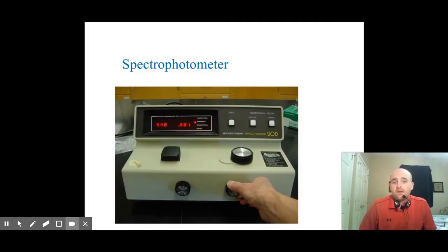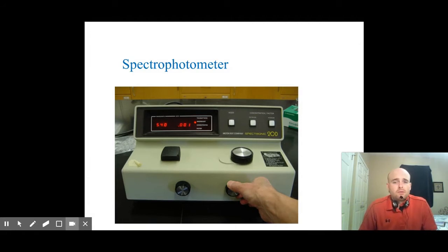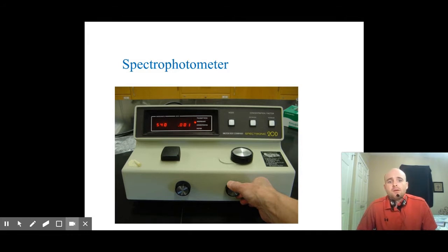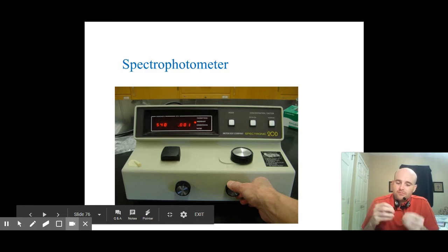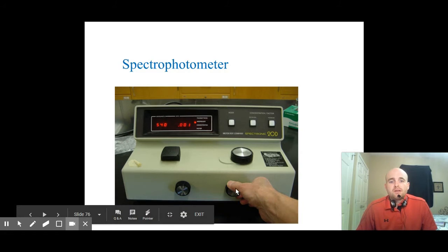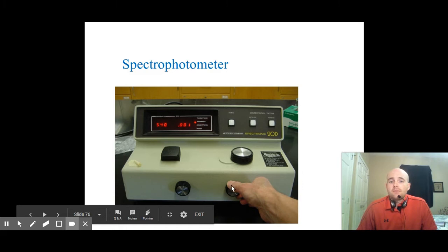To measure the absorbance of our samples, we'll have to use either a spectrophotometer or a colorimeter. This is a picture of a spectrophotometer that is several decades old. I used one of these models in my college chemistry classes, where the sample would go here in what we call a cuvette — a little glass that looks like a test tube — and we could adjust the transmittance and the absorbance through these little knobs right here.